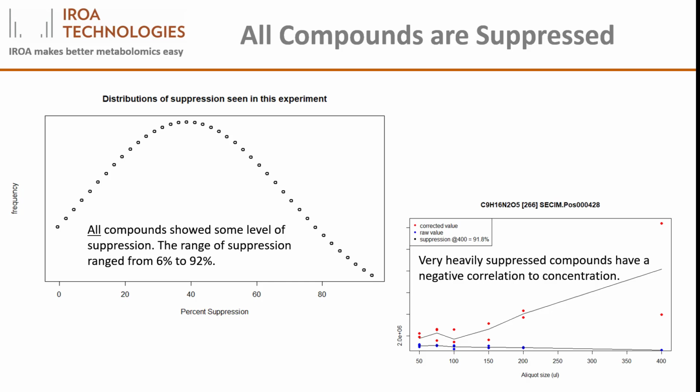The most severely ion-suppressed compound we saw was suppressed at 91.8%, shown on the right, and when its raw data was examined, the raw MS was actually negatively correlated to the actual concentration. That is, it shows less signal the more compound is injected. In general, compounds suppressed less than 60% in these samples were at least positively correlated with their actual concentration, although the correlation may have been poor.